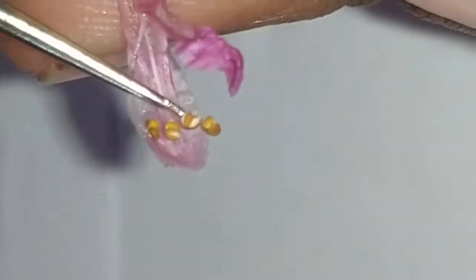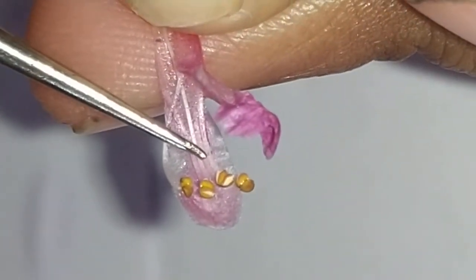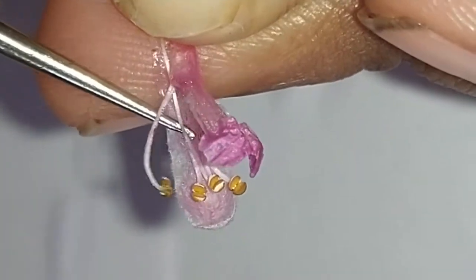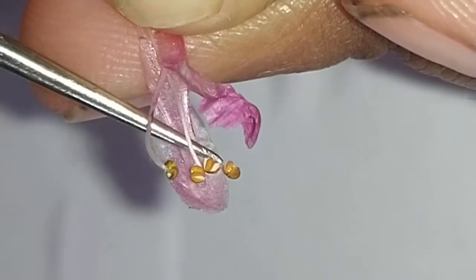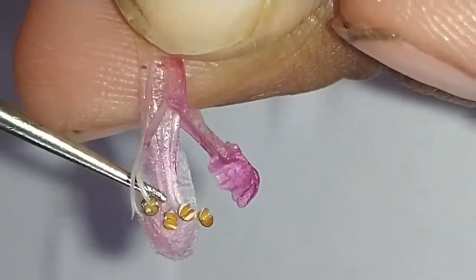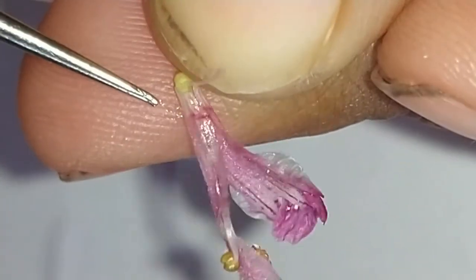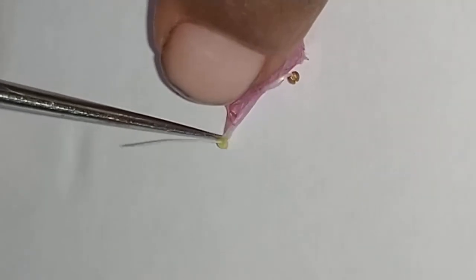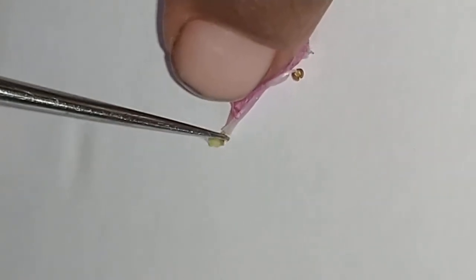These are the four androecium anthers. The filaments are long enough. We have to separate out the gynoecium. You can see that is the gynoecium portion.